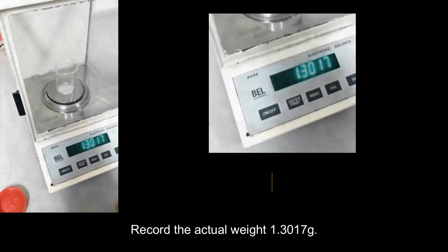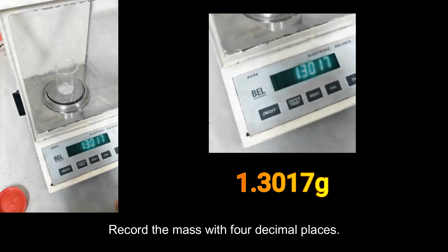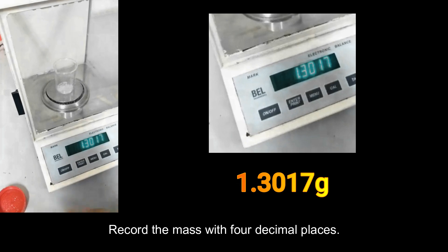Close the doors. Record the actual weight 1.3017g. Record the mass with 4 decimal places.